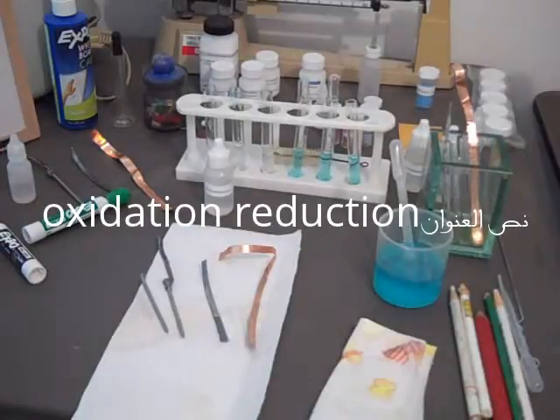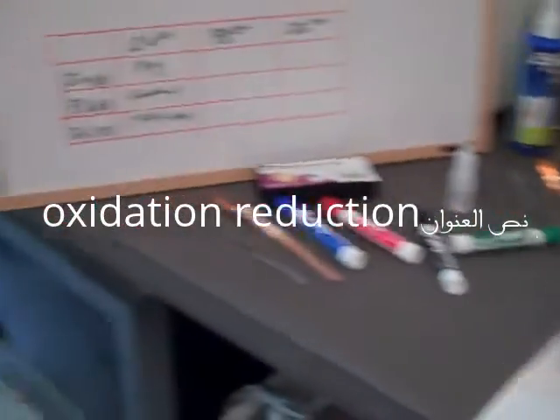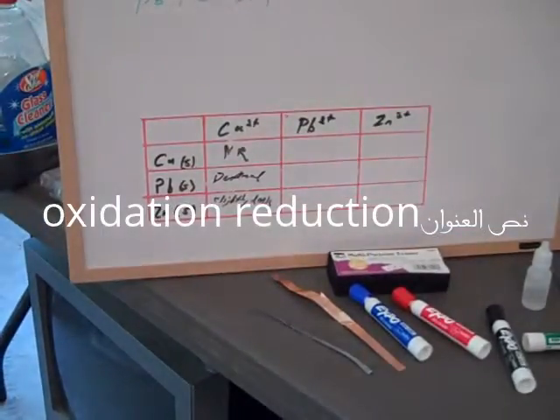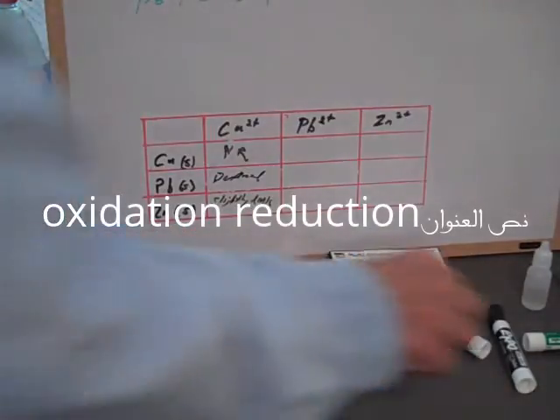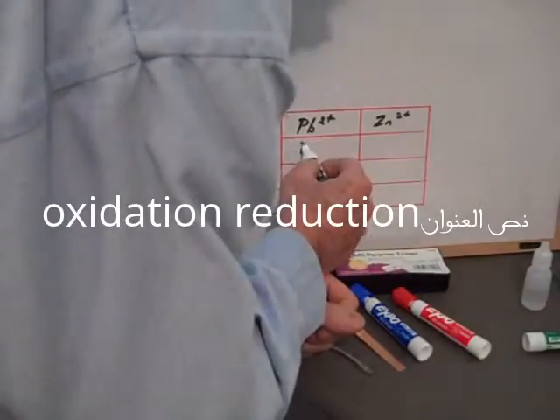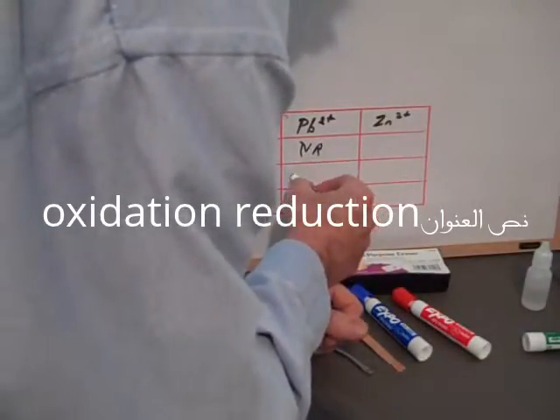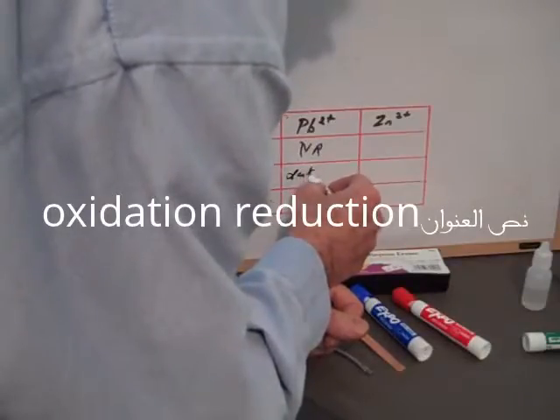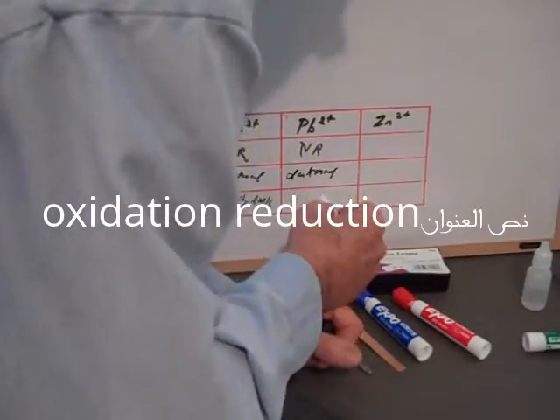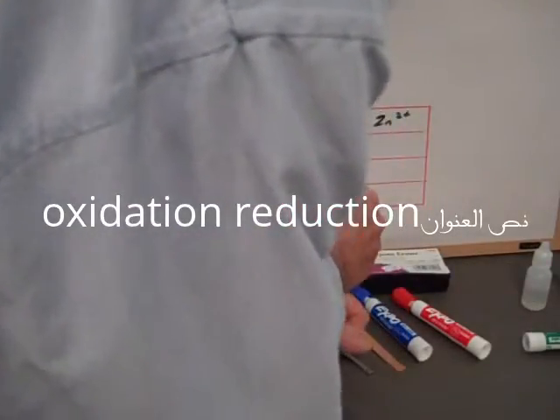For the lead nitrate, we're not supposed to have any reaction. We had no reaction for the copper—that's proper. But the lead, it actually darkened. We're supposed to have no reaction there. And the zinc, very, again, hardly any, very slight, very slight darkening. If you can read that.